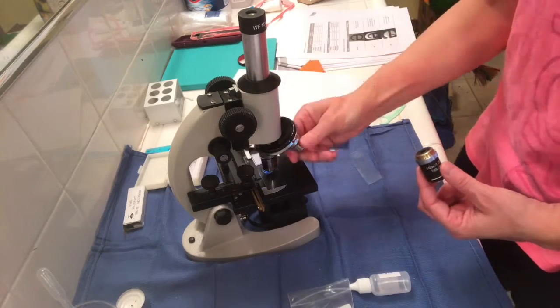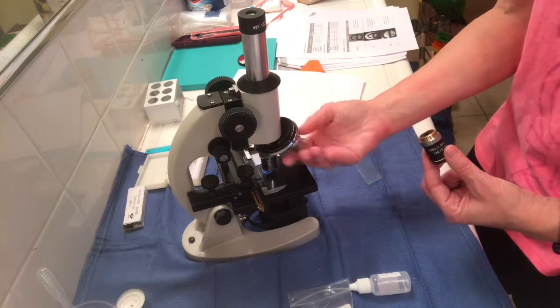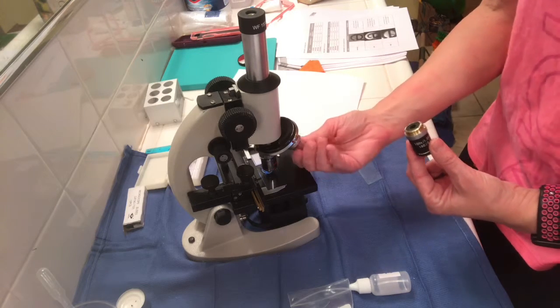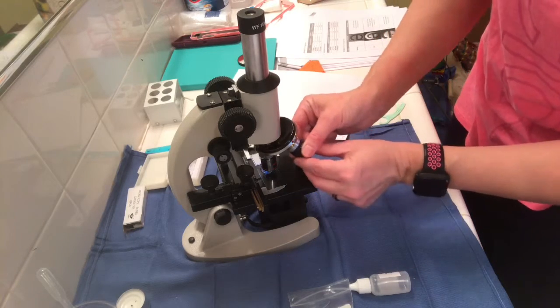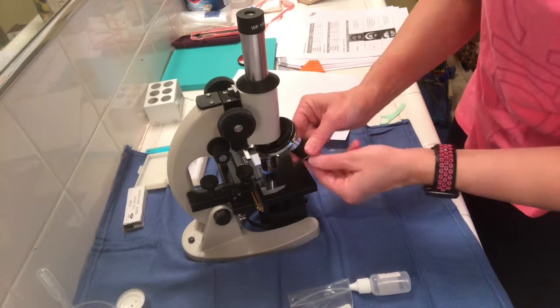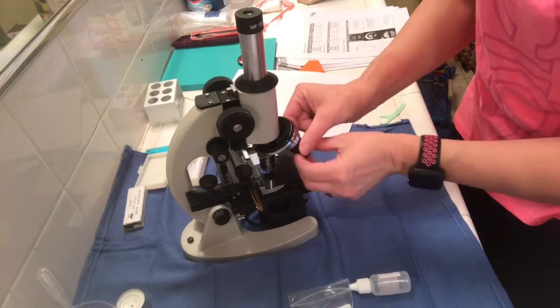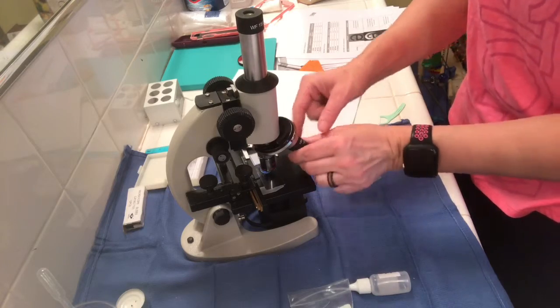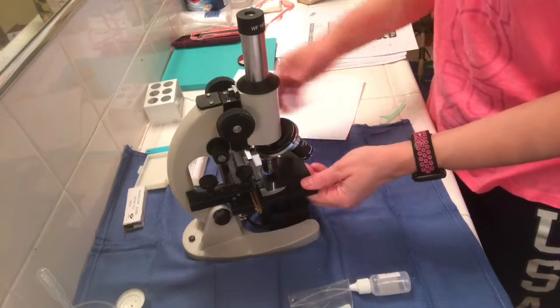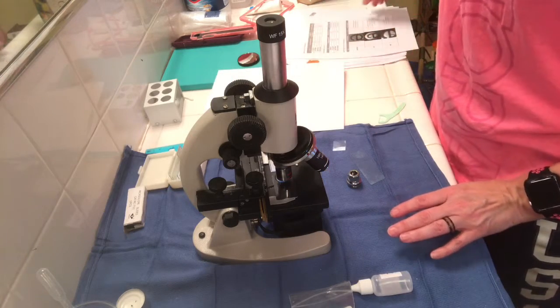And you multiply those by the ocular magnification, which is, let's say for the oil immersion, ocular magnification is 15 times. So oil immersion would be 100. So 15 times 100 equals 1500, and that would be the total magnification. I'm switching the scanning lens to the oil immersion lens to give you an example of what I had to do for looking at slides.